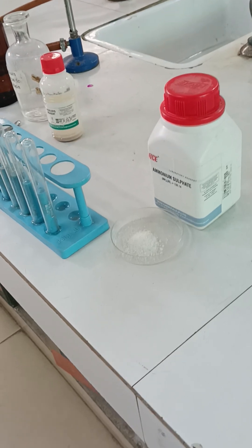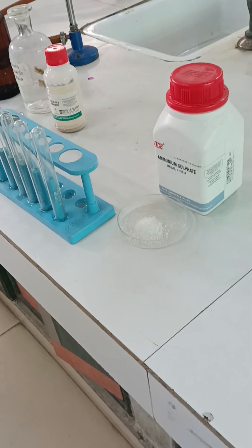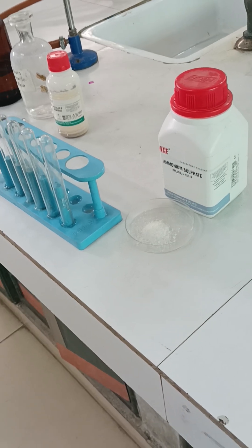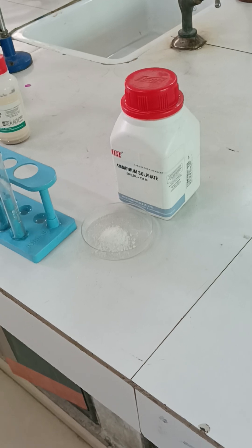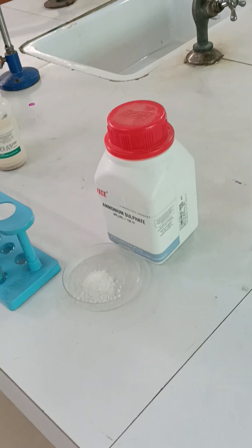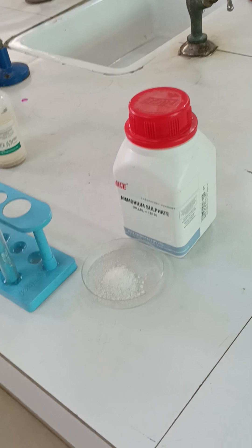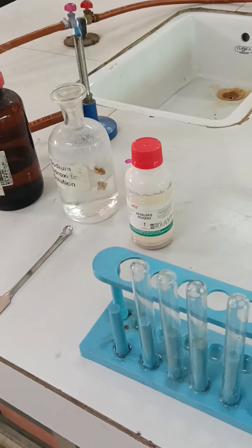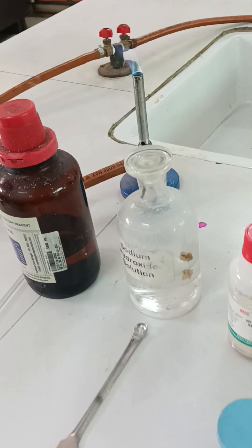Good morning class 11th and 12th. Today we are beginning with the analysis of cation radicals, starting with group 0, that is the ammonium ion. Here I have a salt of ammonium, that is ammonium sulphate — it is white in color. The requirements are Nessler's reagent, the group reagent that is sodium hydroxide.